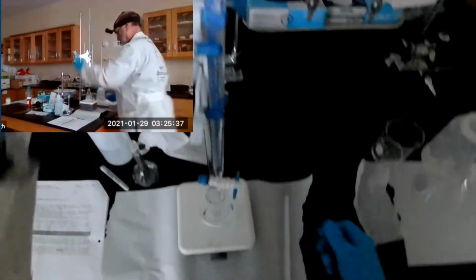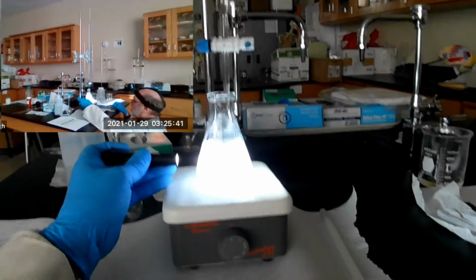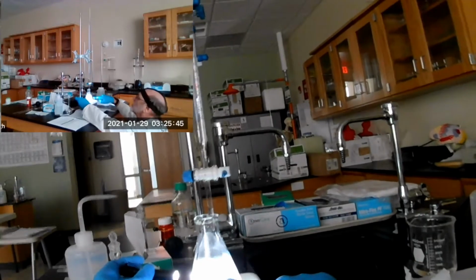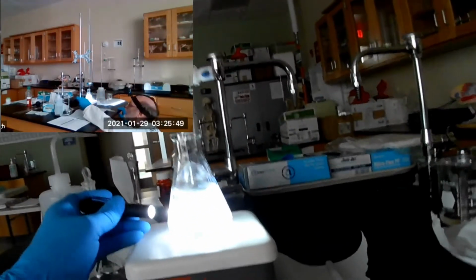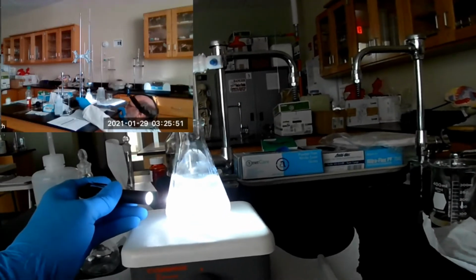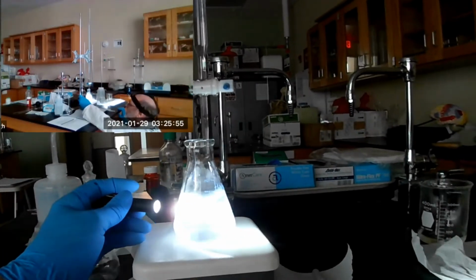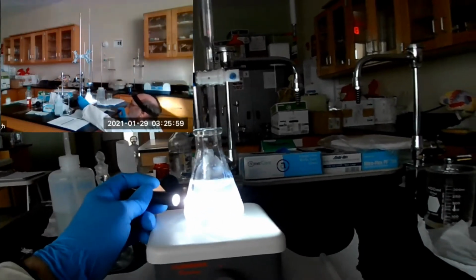There we go. Yeah, you can see it. You can see the light beam right straight across there. Tilt my head back, maybe you can see it better. Come down, so maybe the camera will catch it better. You can still see it. I hope I didn't overshoot it. Okay, you can see it better that way.